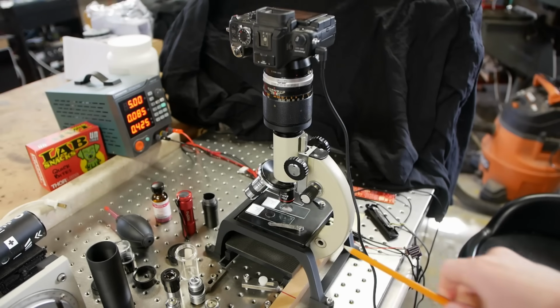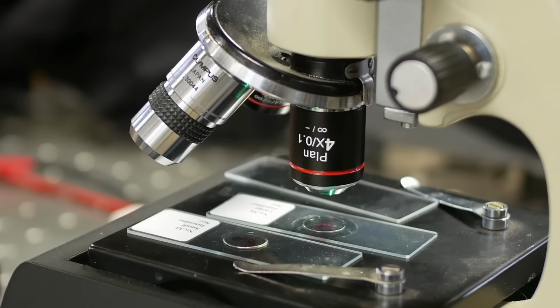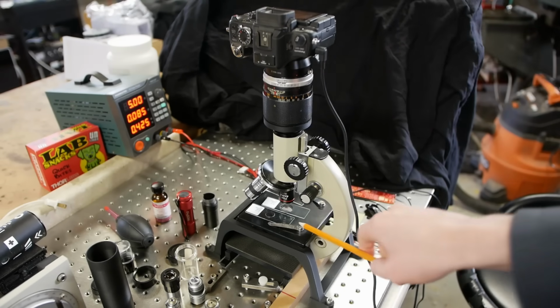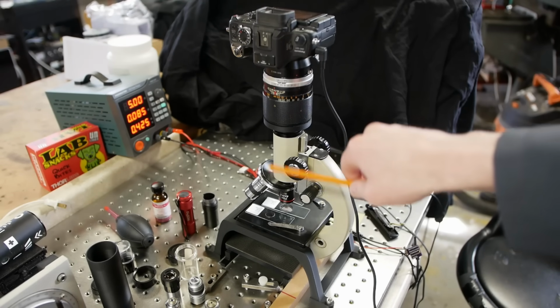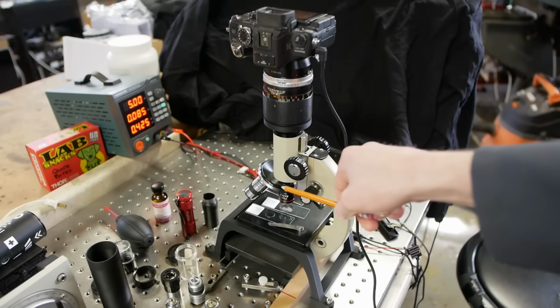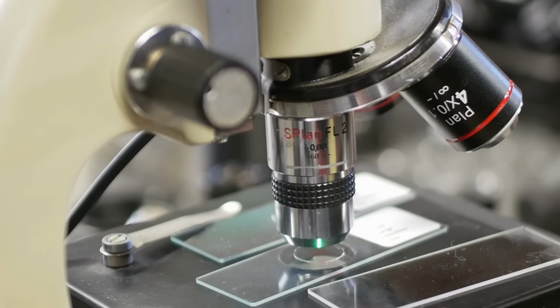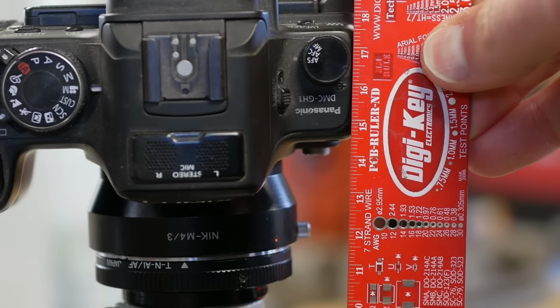This whole process works best with a 4x or a 2x microscope objective. And if your objective has an infinity sign on it, that means that the optical aberrations of that objective are best corrected when the objective has infinity space behind it. In other words, your camera is infinity far away on this side. But since that's pretty impractical, we got to add another lens called a tube lens to focus down this infinity light down to the focal plane of the camera. If your microscope objective has a number here, like 160, that means you do not need a tube lens. In fact, it works better to have the focal plane 160 millimeters behind the microscope objective.